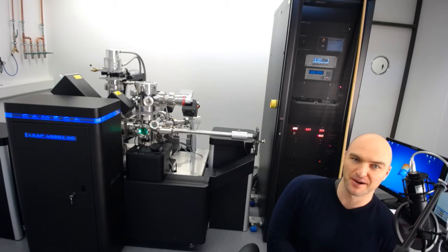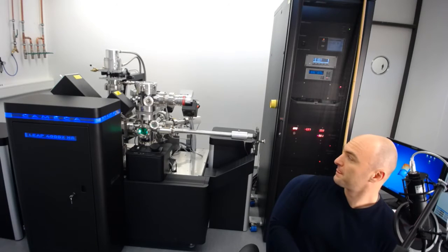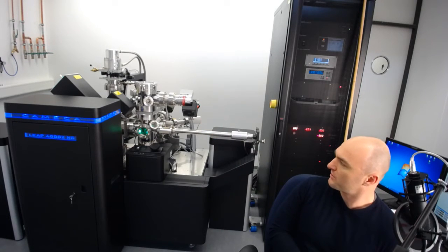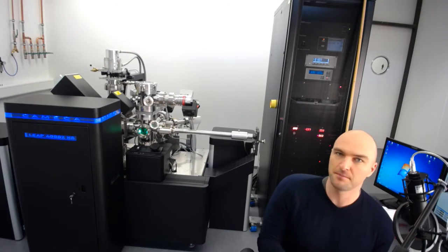So maybe surprise your supervisor and already know something about how to operate the LEAP. To give you an overview of the machine — I've got the machine here and I'll point out things on it — but let's first look at some fundamentals of machine operation.